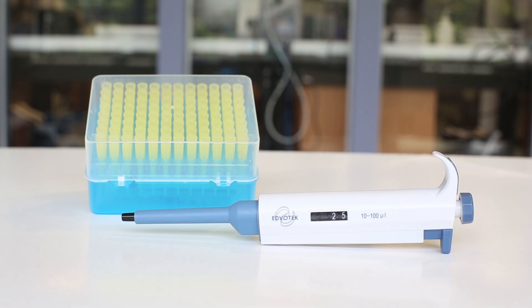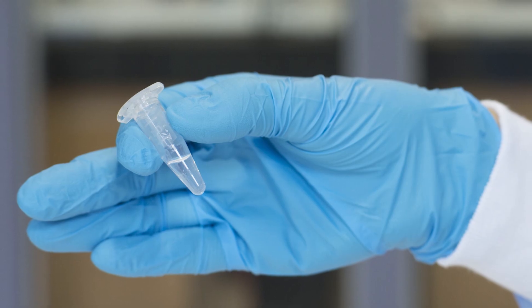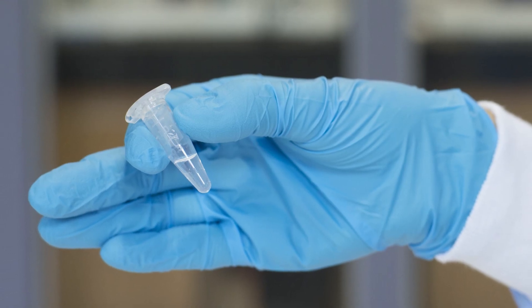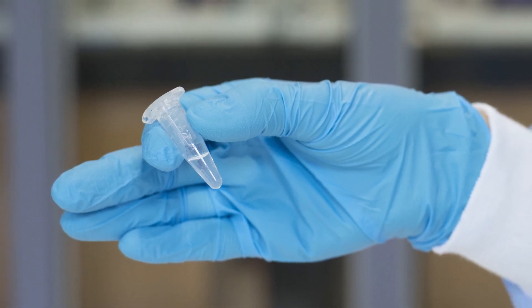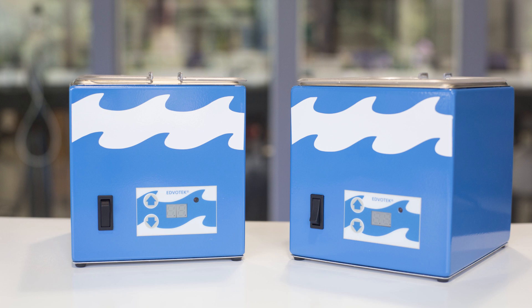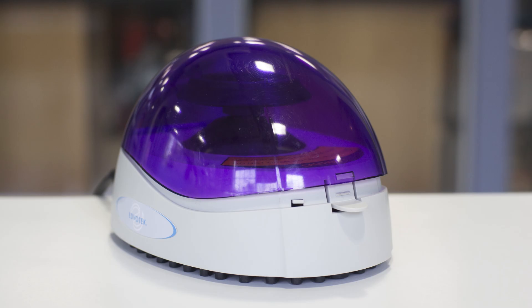You'll also need a micropipette, lysis buffer with proteinase K prepared no more than one hour before the lab, two water baths set at 55 degrees celsius and 99 degrees celsius, and finally a microcentrifuge.